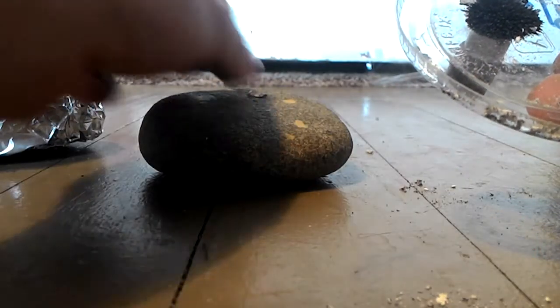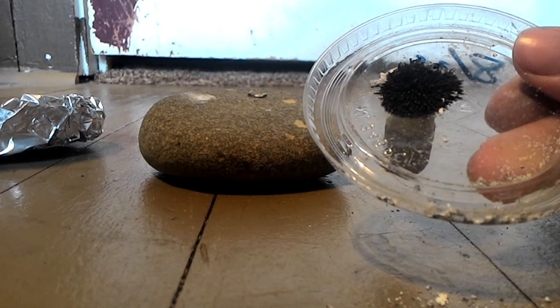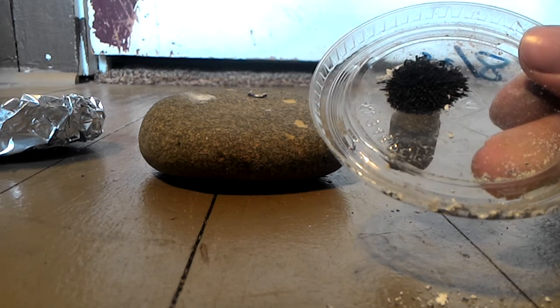Gotta remember to keep it in the camera. Put this over here — this is the piece. Oh my gosh guys, I think that is our piece of iron, maybe. Because as you can see, if I grab this magnesium, it does not get affected by the magnetic field, so we know that this bigger piece of stuff must have iron in it. I think it absolutely does. Wow. Either that, or I just melted the magnetite together, but I don't think so because that was pretty intense and I saw a faint sparking. And that white stuff — it's not really falling off. So I think that I did successfully thermally decompose magnetite that I got from the ground into metallic iron.